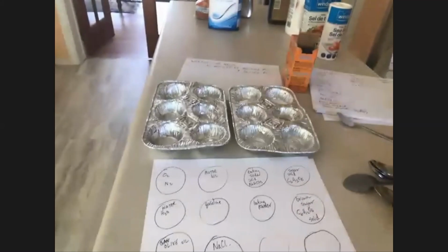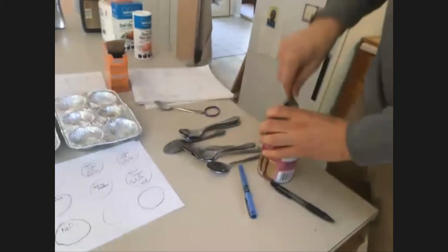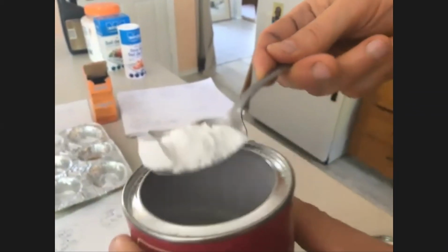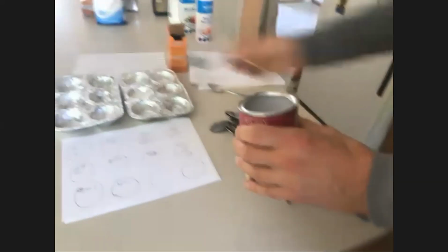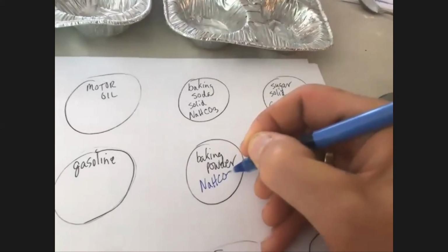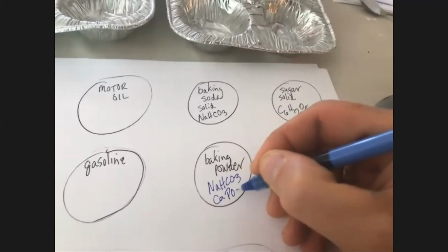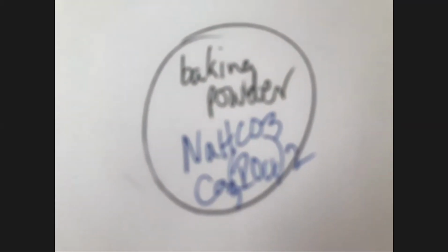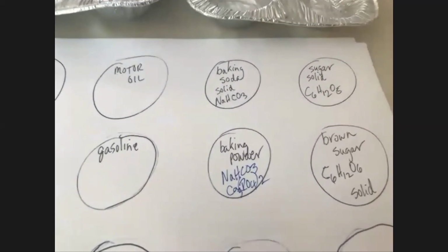Okay, one below that is baking powder, and this one's not been opened yet. Let me get it covered here. So baking powder is baking soda, plus it also has maybe some calcium phosphate in it. There's some baking powder, and that goes in that spot. So baking powder is often a mixture of sodium hydrogen carbonate and calcium phosphate. This is a 3, that's a 2, so it'd be 3 and 2. Okay? Yep. Back up a little.